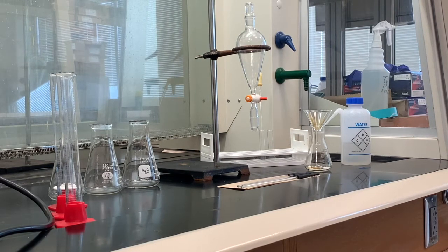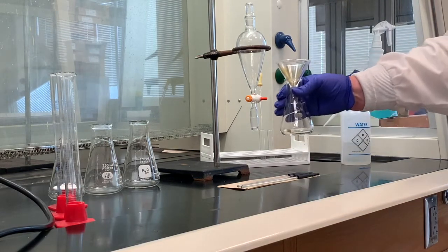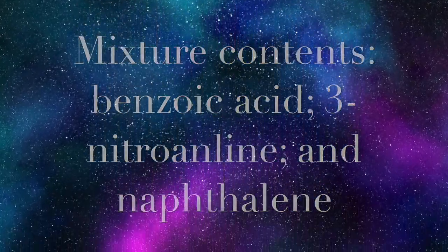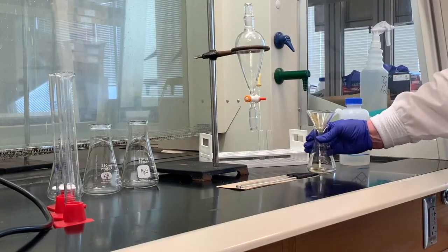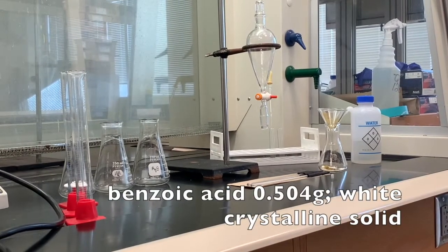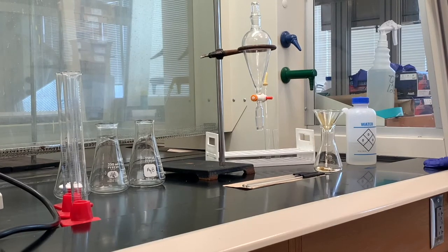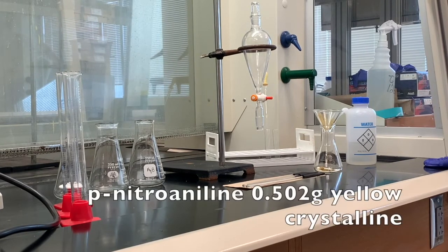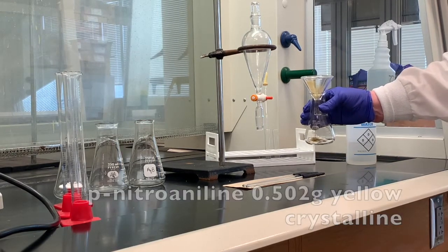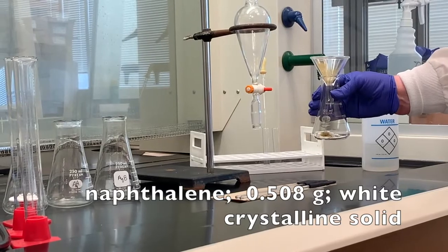In this case, we're using a mixture of 3 different substances, and I went ahead and weighed them out, and they're in this Erlenmeyer flask. The mixture contains close to 0.5 grams of benzoic acid, which is a white crystalline solid. We also have close to 0.5 grams of p-nitroaniline, which is the more brownish yellow substance there. And then we have close to 0.5 grams of naphthalene, which is another white crystalline solid.